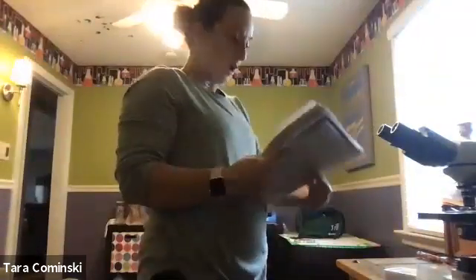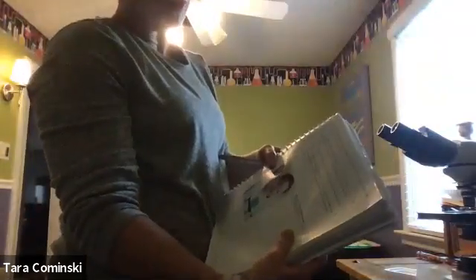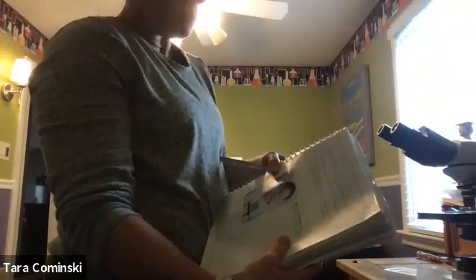okay. So now we are moving on to page 13, okay? So now we're on number 4 on the top of page 13. It says, fill that graduated cylinder with water to about the 20 mil mark. I already did that, okay? It says, hypothesize how you could use this setup to calculate the volume of an object, okay?